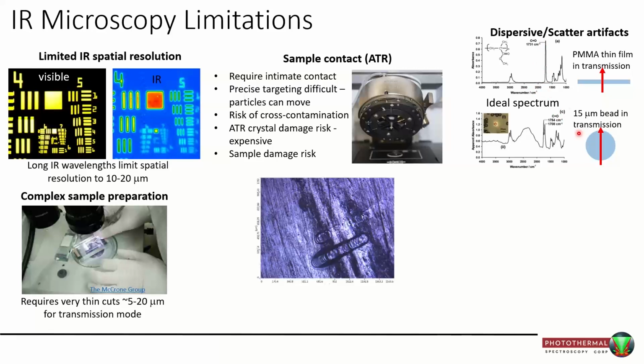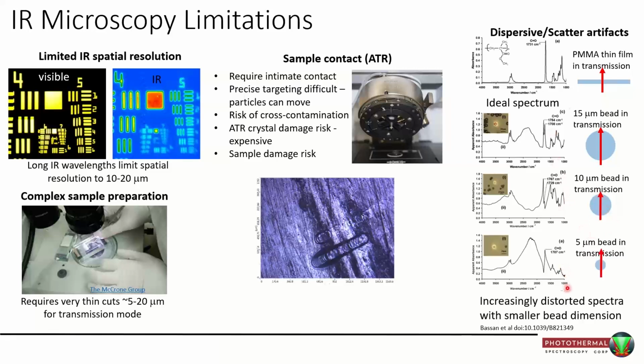But if you take the exact same material and measure that in transmission mode, not in a flat thin format but a spherical bead of say 15 microns, the spectrum looks very different. And if you change the size of that particle, keeping the chemistry the same, the spectra change. So it really goes to show how spectra, at least in traditional systems, are not always reflective of the chemistry, but there's a lot of sample morphology and topology that is convoluted into the spectral shape, which of course means identifying and interpreting the spectra can become difficult and can mislead you.